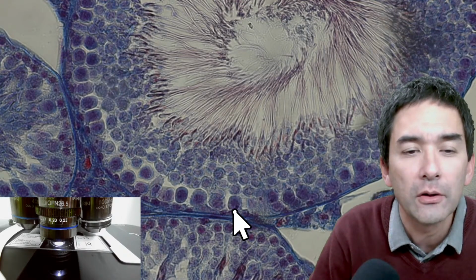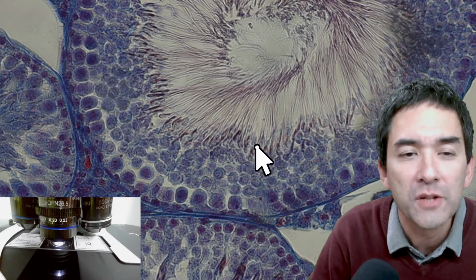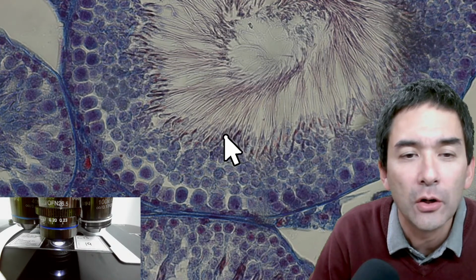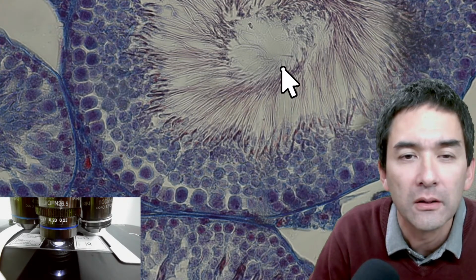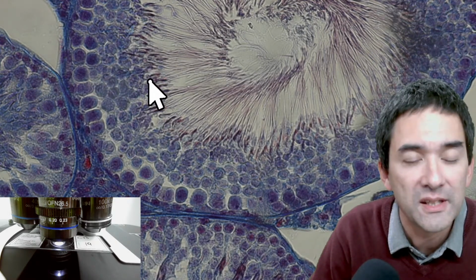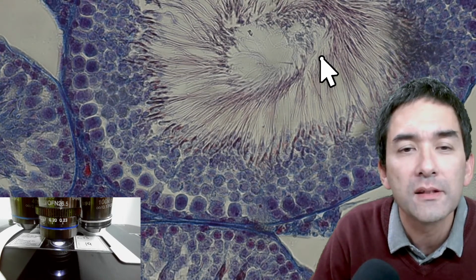Okay, look, I'm going to explain this to you. Okay, so you have the germinal epithelium layer over here. The cells divide, they undergo meiosis until you have 4 sperm cells per starting cell. And what you have over here, these are the heads of the sperm cells before they detach. So that's basically the head of the sperm cell, and then there's a long tail. Yeah. You see hundreds of them in one seminiferous tubule. And as I read somewhere, a human man makes approximately, I don't know, 70 million sperm cells every day. So I think that's quite fascinating to see here.